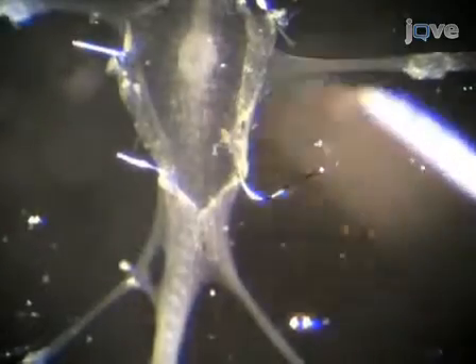Using this neural network, we can investigate several fundamental principles of neurobiology, such as neuromodulation, homeostasis, network variability, network development, and network recovery. So let's get started.